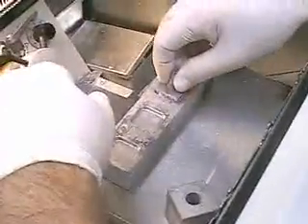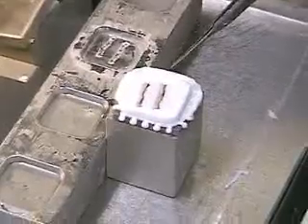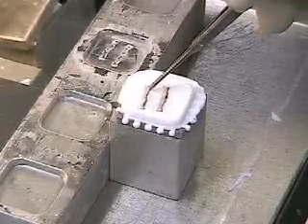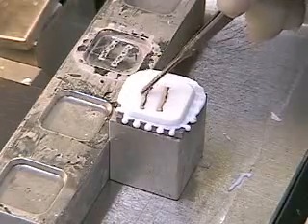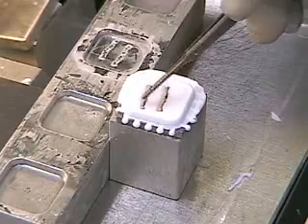Now that those are down flat, I'll fill my well with a nice bulge, place my chuck on nice and flat, and the overchuck freezing block. And that's the entire process. Here you see the completed block — the inked margin is visible on both pieces very nicely, and that was where we paid our attention to pulling it off the dispensing slide. The epidermis, although it's very hard to see, is also present and these are nice and flat embedded.